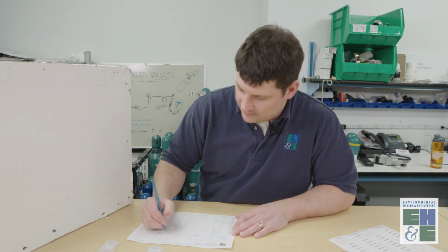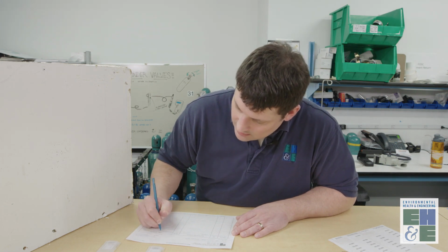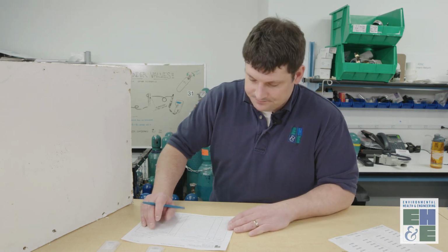So in this case I'll say surface of wall. When you're in the field, it's also important to document where the wall is and where the sample is collected specifically. So if that's wall under the desk or 3 feet up from the bookshelf, all that information should be collected so that it's known exactly where you collected the sample.